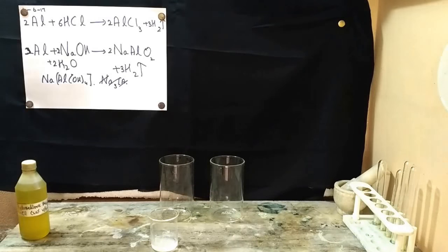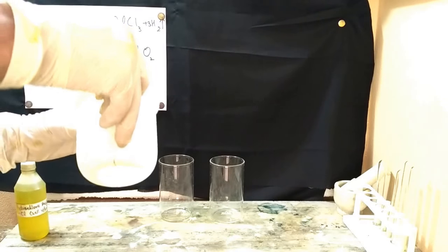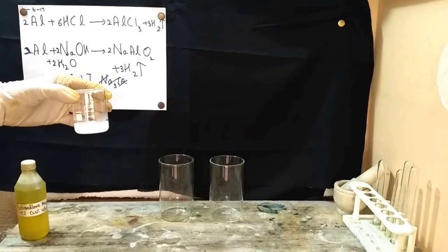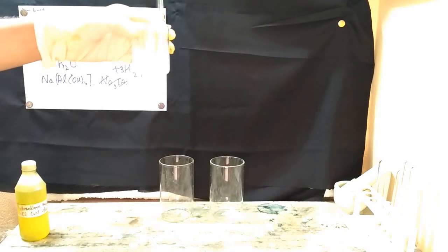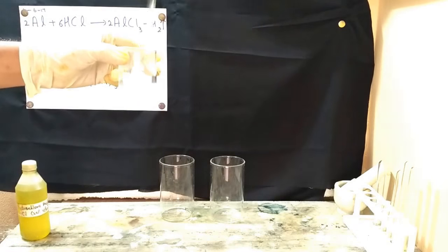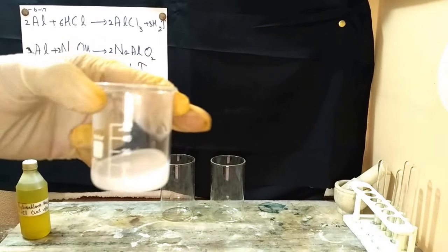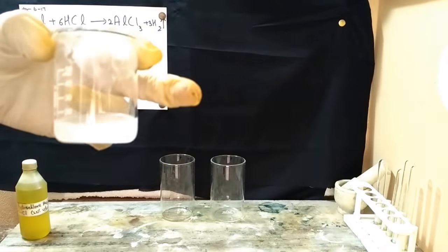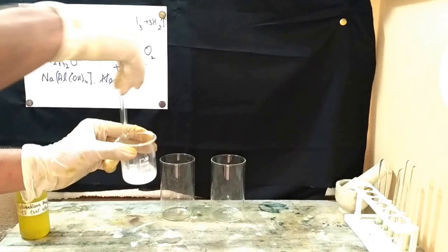Sorry for the disturbance over there. Addition of water to sodium hydroxide is very exothermic, and sodium hydroxide takes quite long to dissolve in water. Using a stir rod, give it a good stir. You can see that there's some steam which has condensed on the walls of the beaker. The heat which was evolved in the reaction caused the water to evaporate.